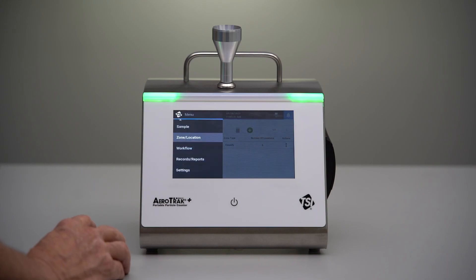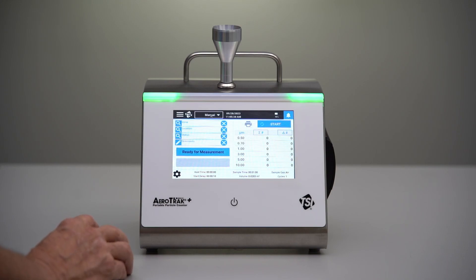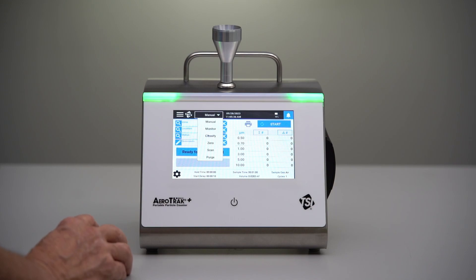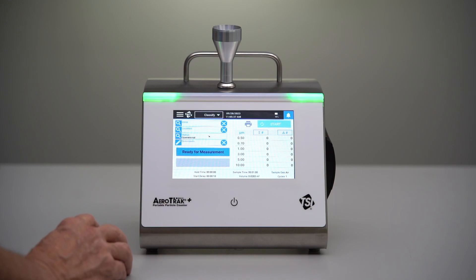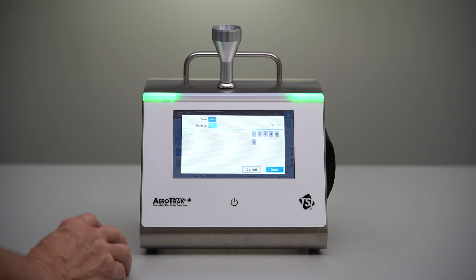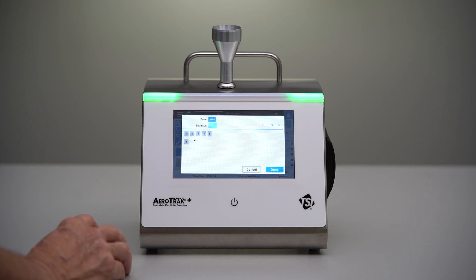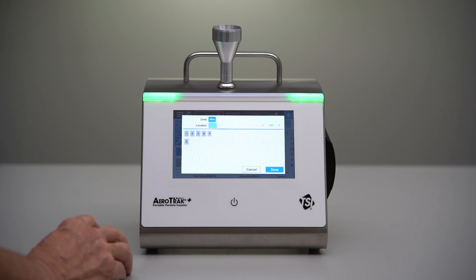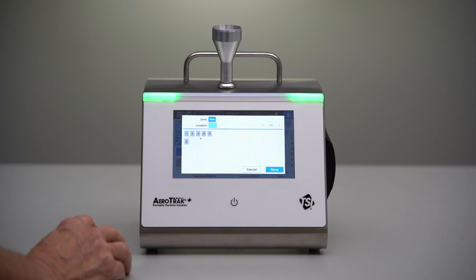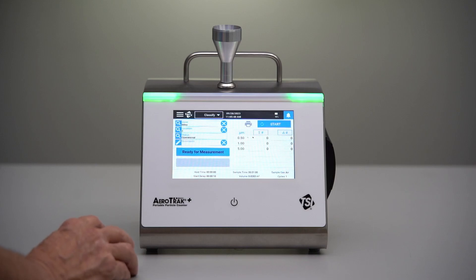It's available for use. If we want to go out and collect a sample in our new zone, we just have to make sure that we're in Classify and we'll pull in the zone that we just created, pick a location — we don't need to test them sequentially, the instrument will keep track of the sample locations — whichever location we want, we'd start with.